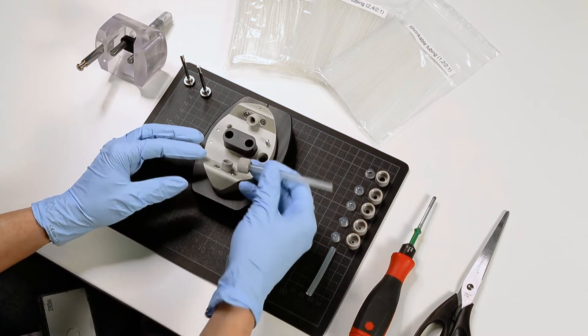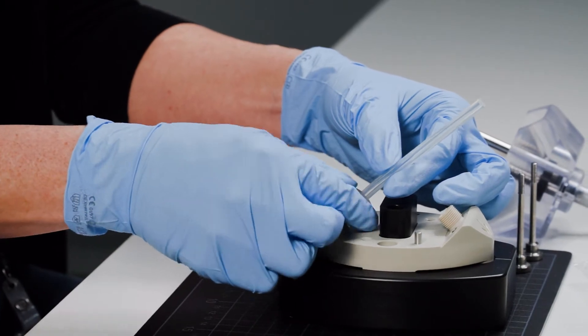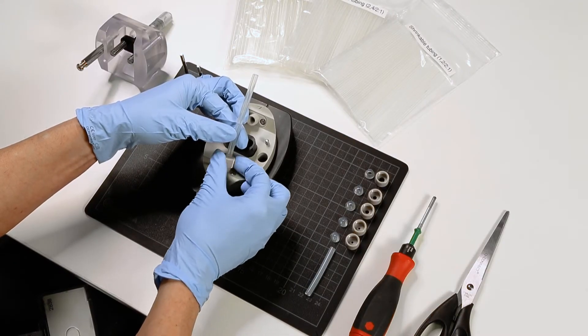Use the lower position, position where no arrow is indicated, to mount the leveled tube sample. Fix the cap screw carefully only with little force to avoid squeezing the tube sample.